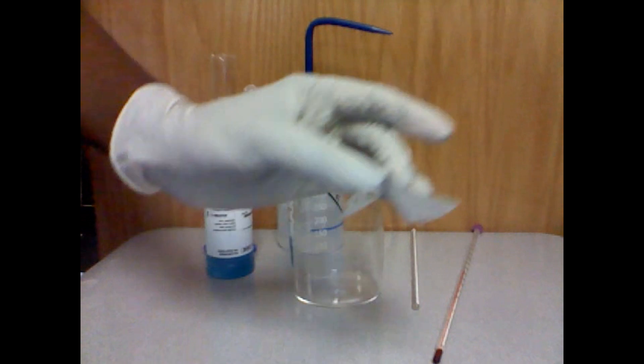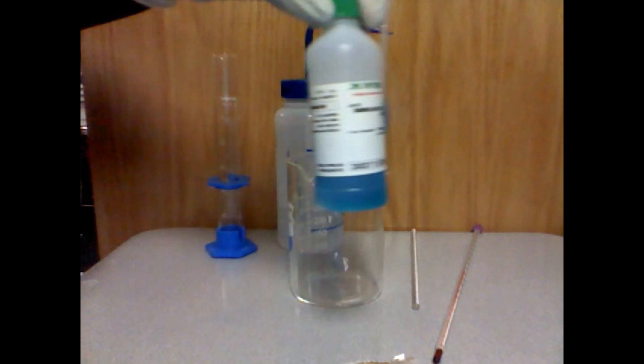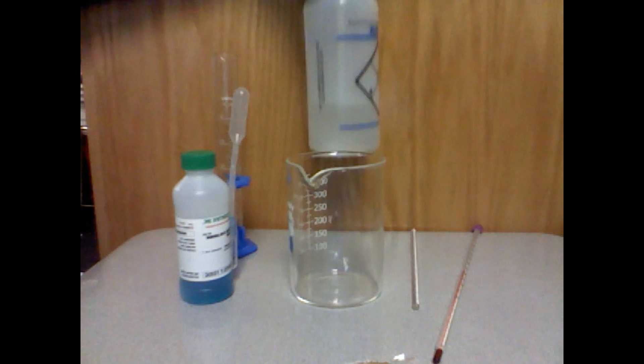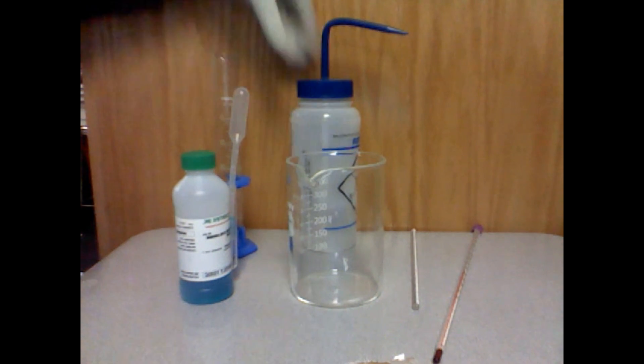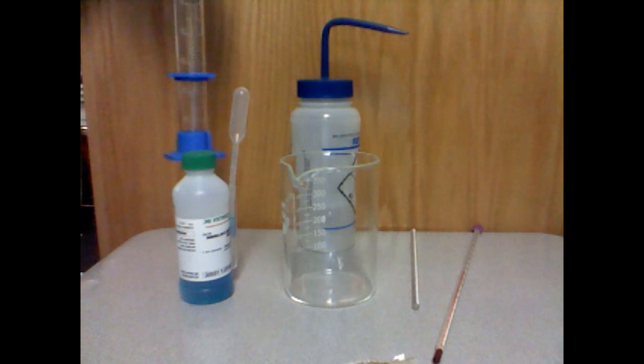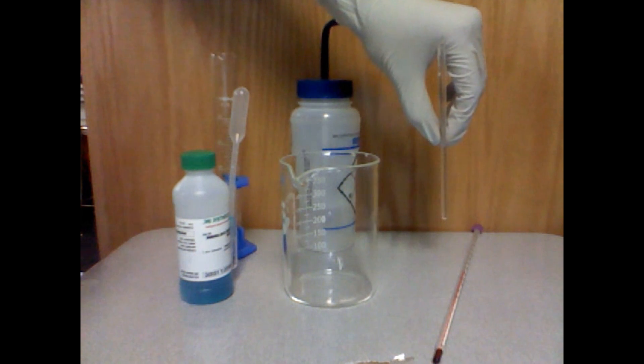Materials: aluminum foil, copper(II) chloride solution, water, beaker, graduated cylinder, stirring rod, and also a thermometer.